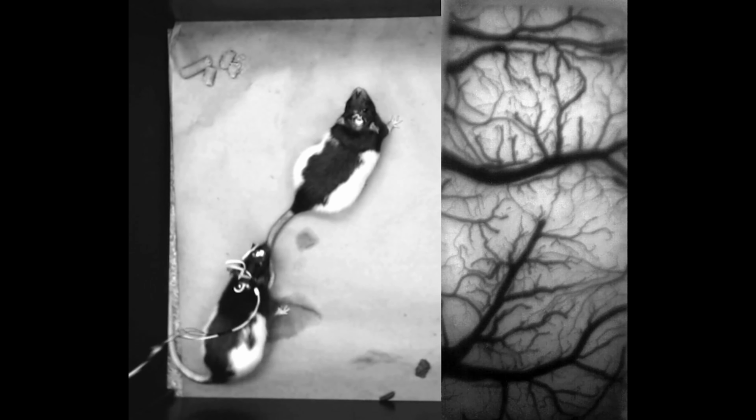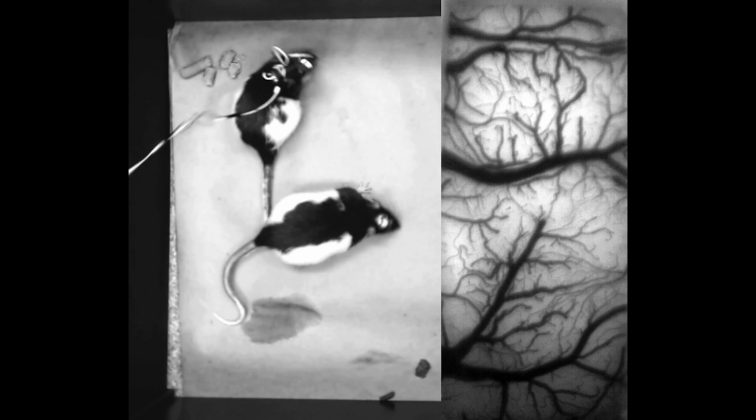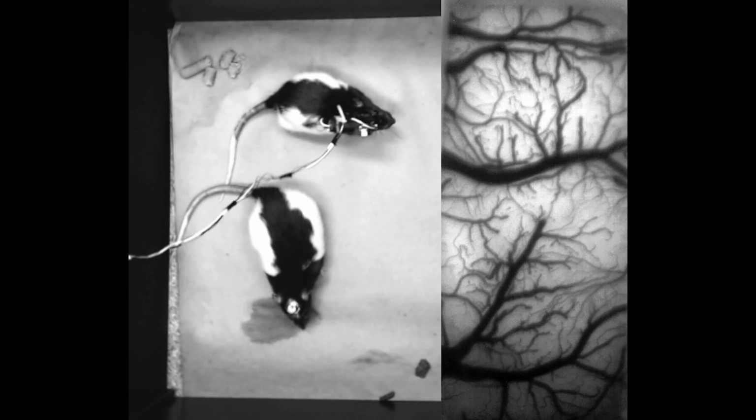This area was sufficiently large that we needed a new way to deliver calcium sensors in rats. In parallel, we produced transgenic rats that express the genetically encoded calcium sensor GCaMP6f in cortical neurons. While the transgenic rats moved through their environment and interacted with others, cScope allowed us to image multiple cortical areas simultaneously.